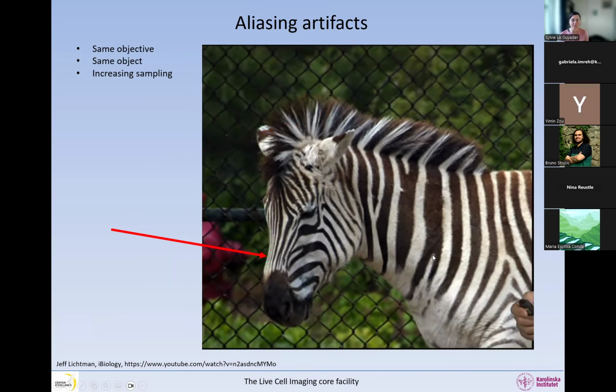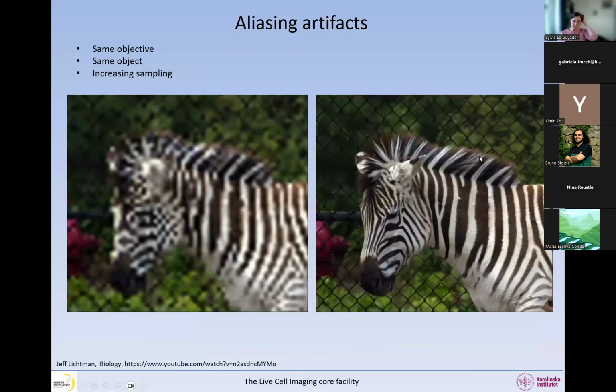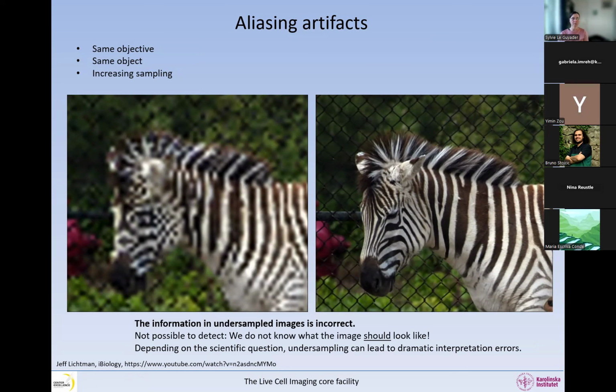So we sample even better, and now we can still see a tiny bit. So only the finest details now get artifacts. And if we sample even better, now even these small artifacts disappear, and now the poor zebra has no frizzy hair anymore. So if we take one of the worst ones with the real one, you can see the difference. There are lots of artifacts that are created in the image. The same thing exactly happens in our images when we undersample.